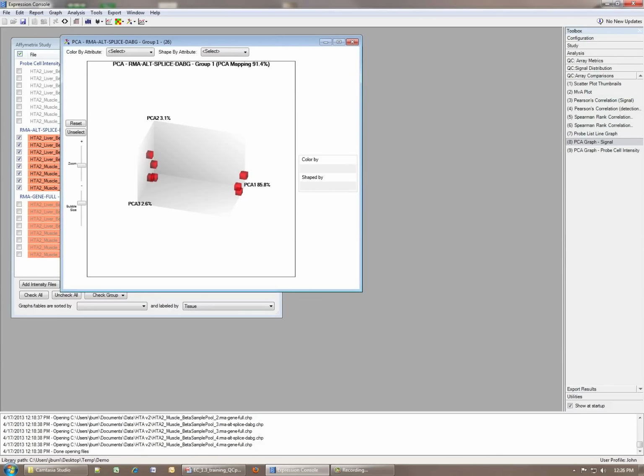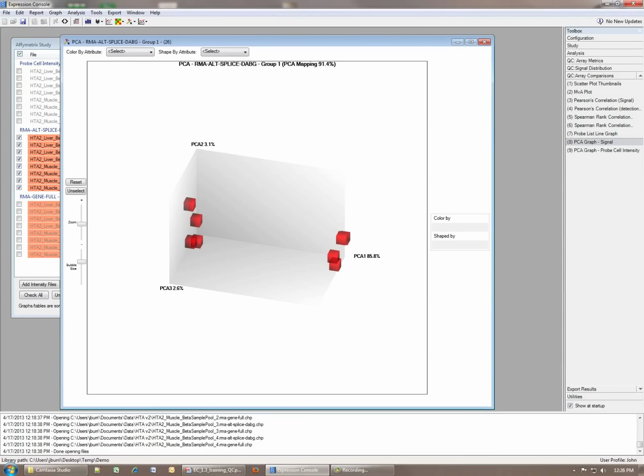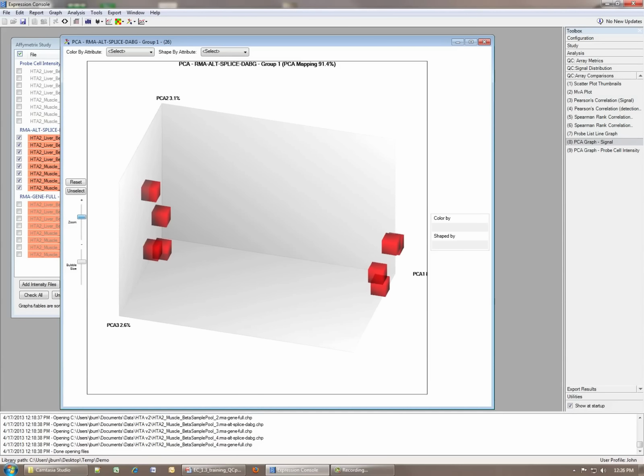I'm going to resize it a little bit to make it larger, and I'm going to zoom in to make that, now that I made it larger, fill in. So what are we looking for in a principal components analysis? Well, you can see that based on this we have 2 clouds of data, if you will, or the samples are displayed in 3-dimensional space, based on the analysis of the signal distributions. Now what you're interested in is what sample attributes are similar.